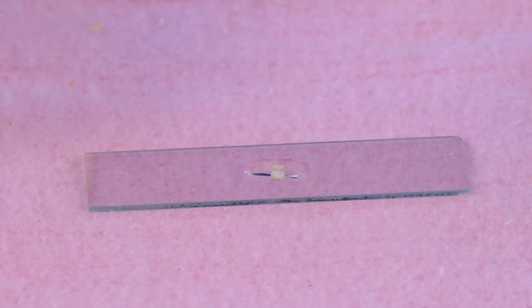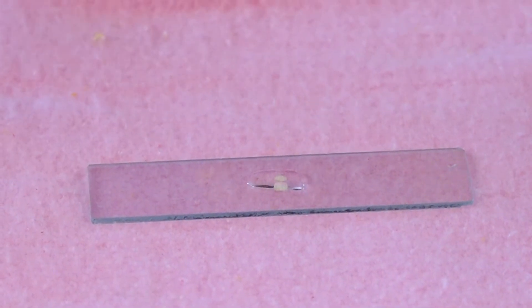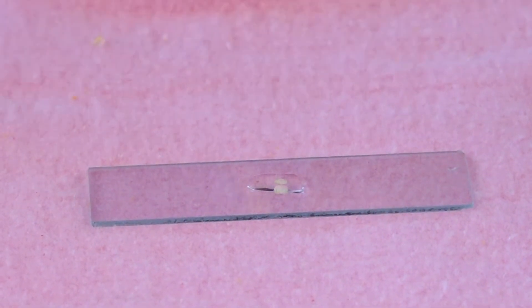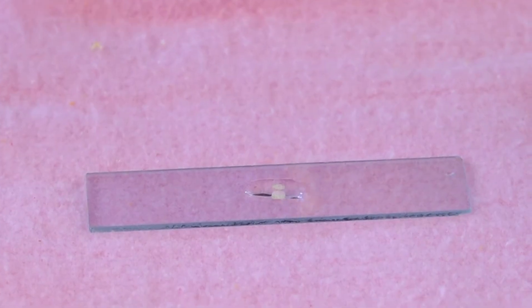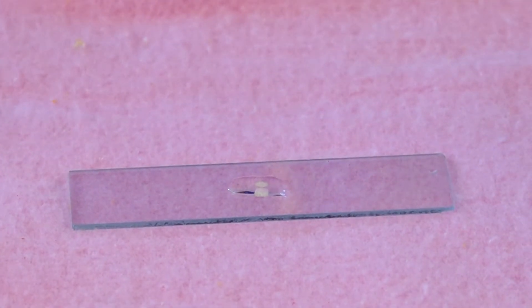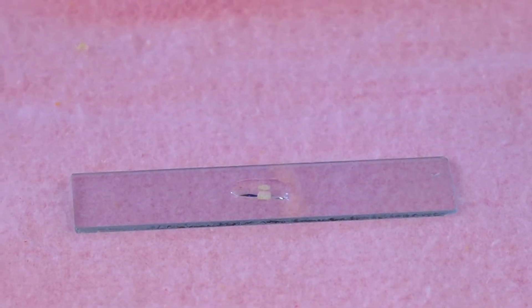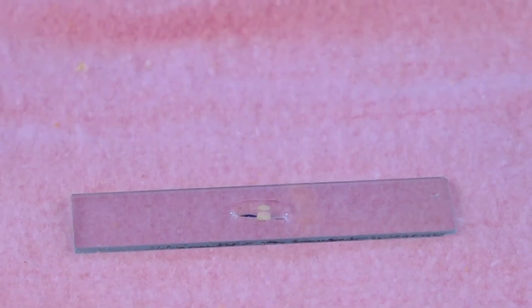This is the cover slip. Once again wipe the cover slip. Hold the cover slip in your left hand and use the needle to carefully lower it onto the slide.